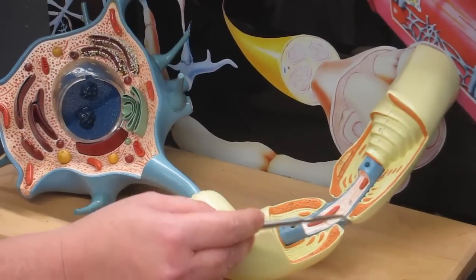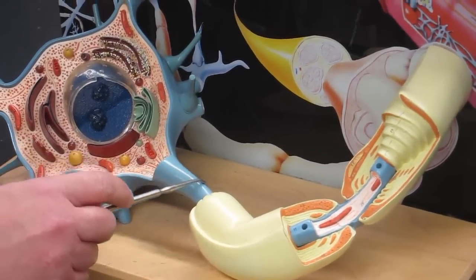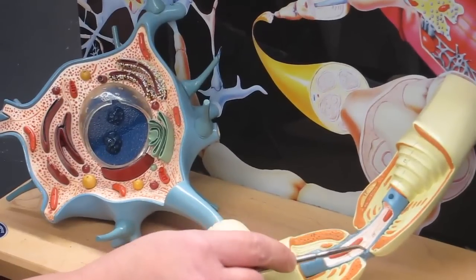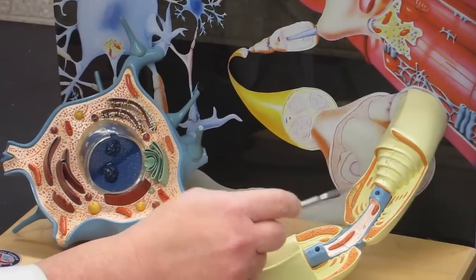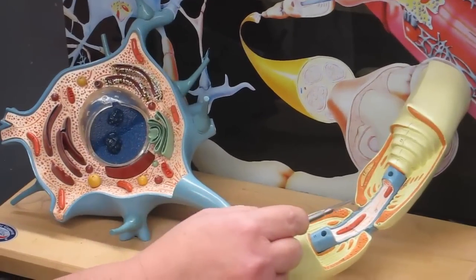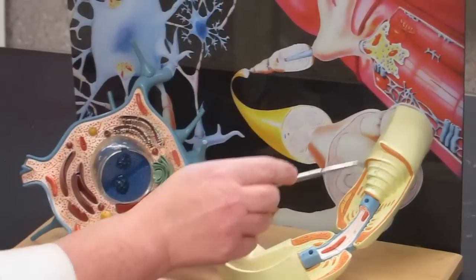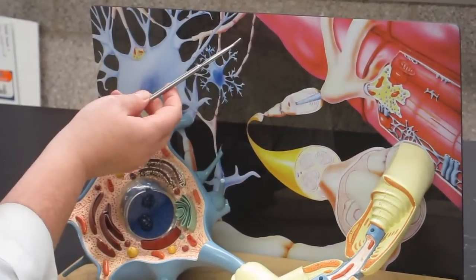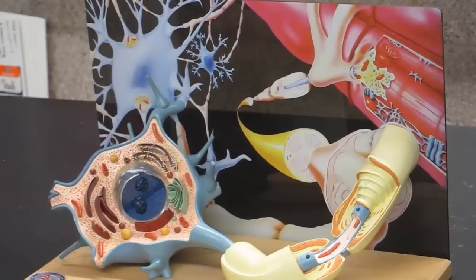This is a node of Ranvier. When you have an action potential that starts in a myelinated axon, it flows externally until you get to the myelin, then it flows internally until you get to an exposed area again, where the channels open up, sodium rushes in, and then it flows internally until you get to the next node of Ranvier. Because you have this saltatory conduction — where the action potential skips segments of the axon — the transmission is faster and maintains its signal strength all the way through to the axon terminals. Again, we're looking at muscle fibers here, so this is another multipolar motor neuron.